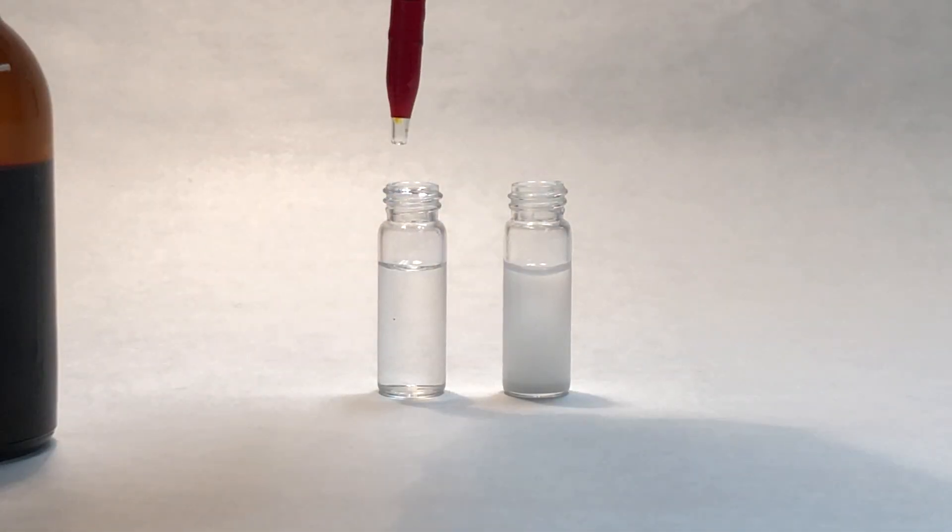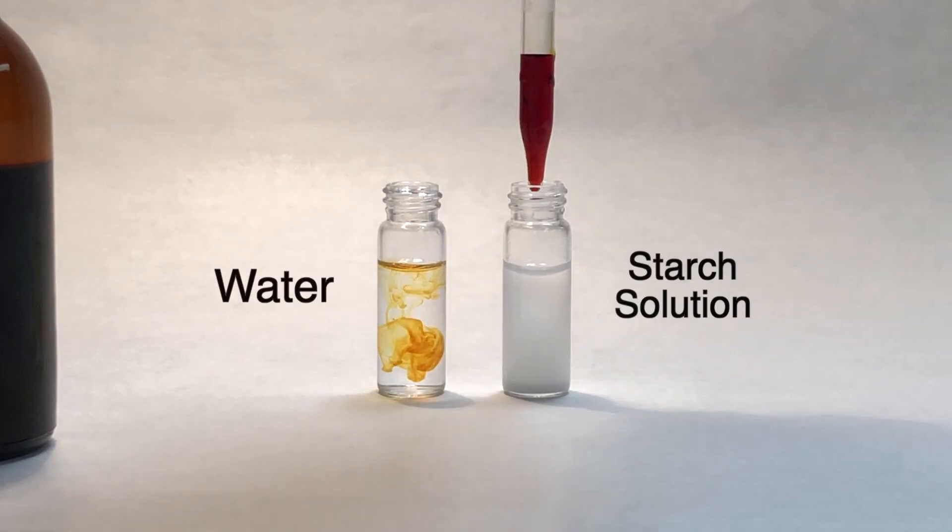For this demonstration, I have two vials. The one on the left is pure water, and the other is a starch solution.